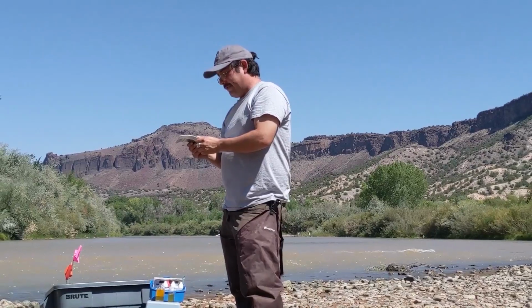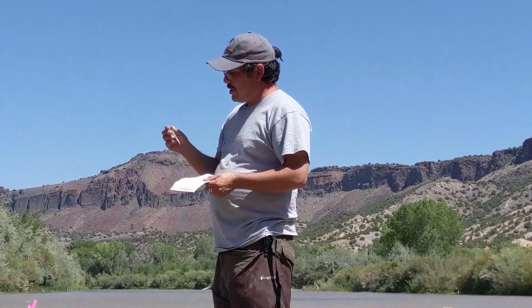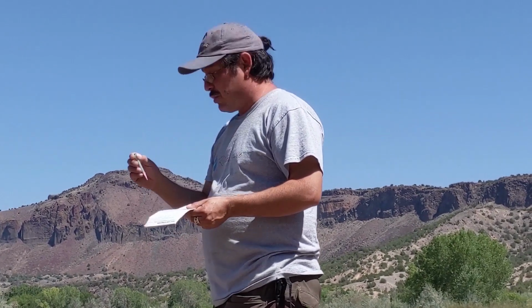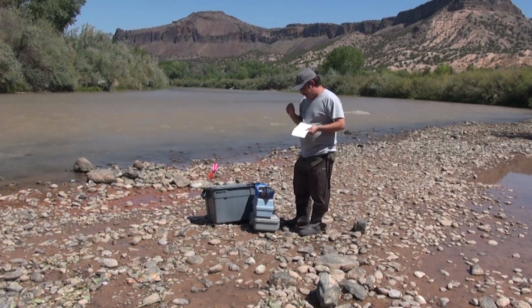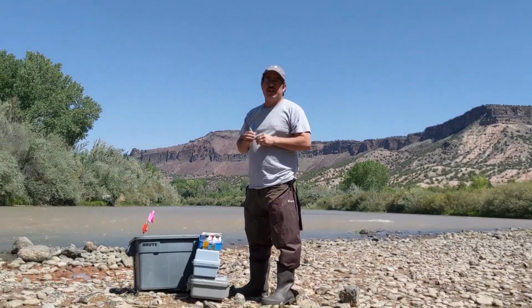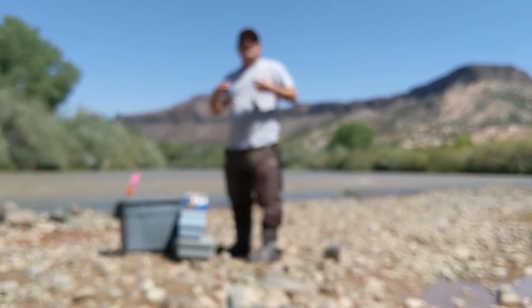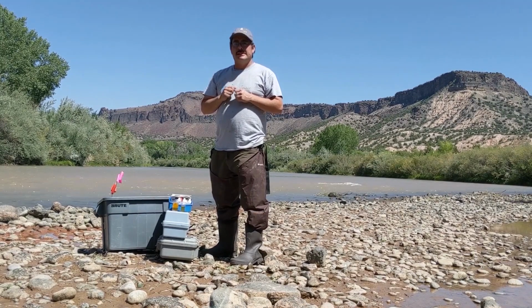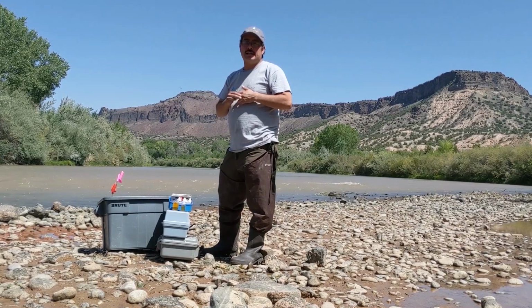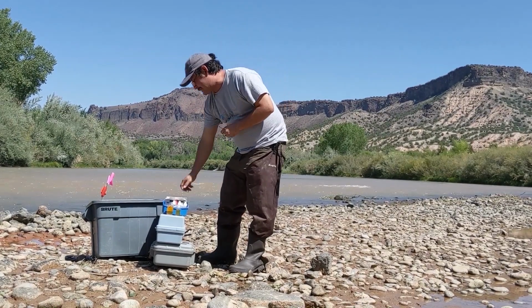Okay, the next part of the test says to fill the titrator. The titrator is something that looks like a syringe. The syringe is a way to measure how much of a solution we are going to need in order to titrate that sample. As you heard me say the term titrate, titration is almost like a chemistry experiment where we're trying to figure out how much of one solution it takes to balance out another solution. Since the last liquid that we placed in there was an acid, the sulfuric acid, we are going to be utilizing a base in order to balance out that acid.